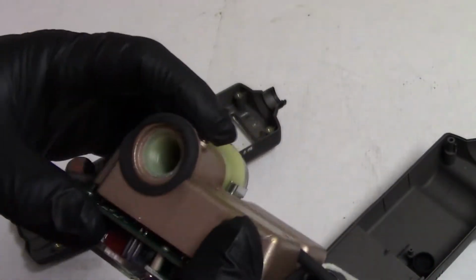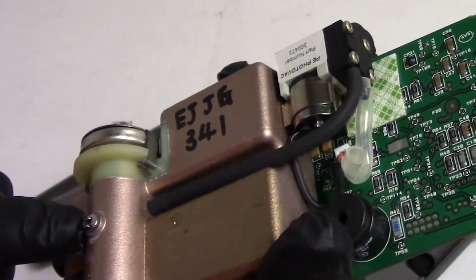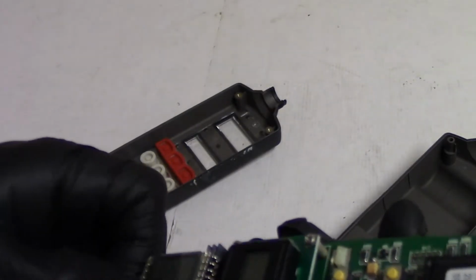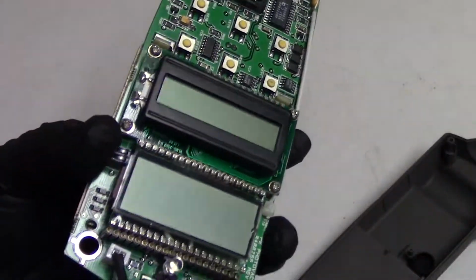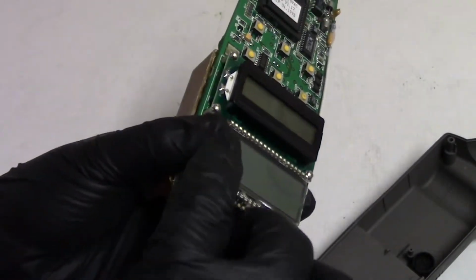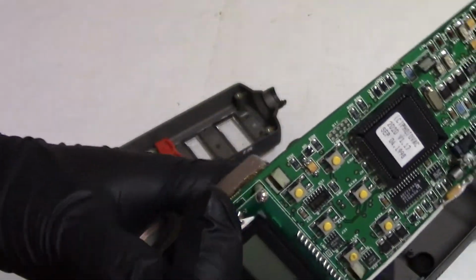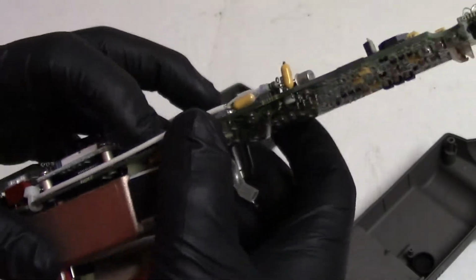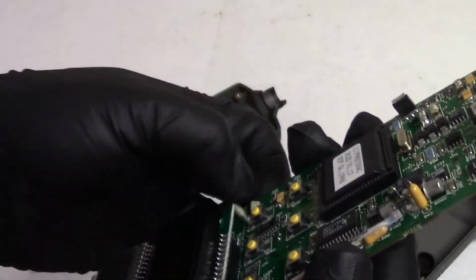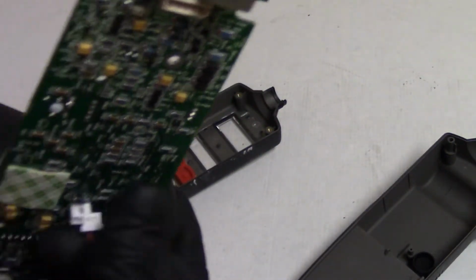I think this is a sensor. This must be a light sensor to tell it when the UV source is on. It only has 2 wires, so my guess is it's a photocell of some sort. Let's unplug it. Then let's pop that whole detector assembly off. Unplug the pump.